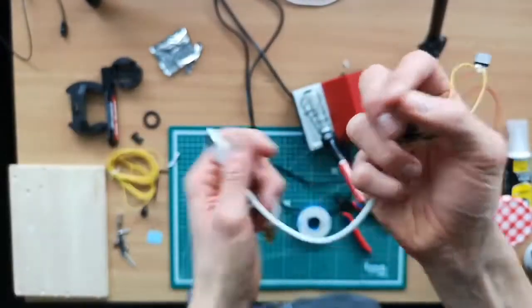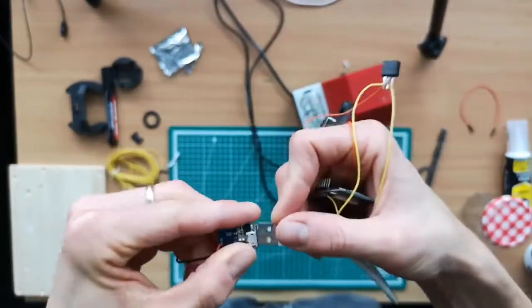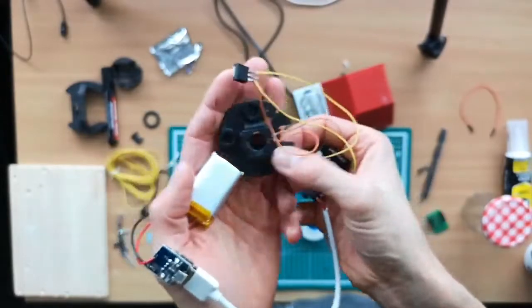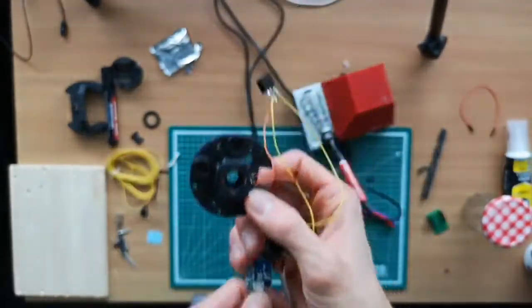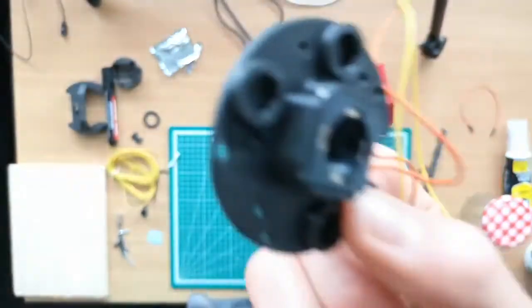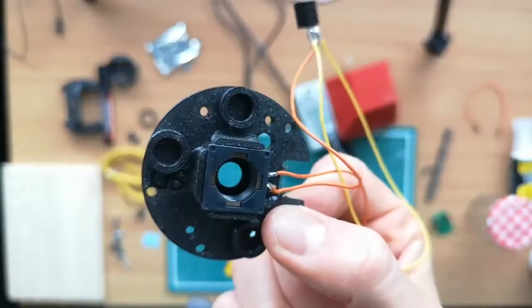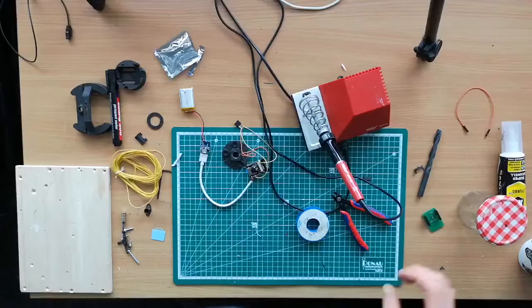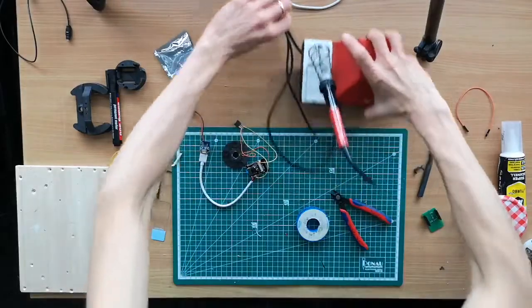What you can do now is connect this here to the freshly connected power bank. If the battery is already charged, you can just plug it in, and then it should give you 5 volts, but I doubt that, yeah, it's already working. So what you just heard was the lens going up and down, so that's just the boot up check. If you connect it, you can hear the sound, and also see that the lens is moving. Yes, so everything works. So we are done with the soldering.